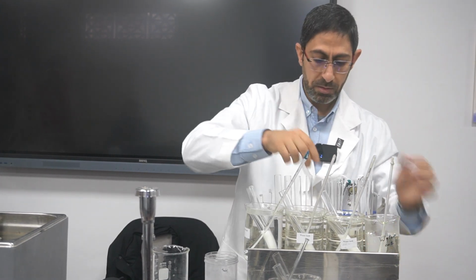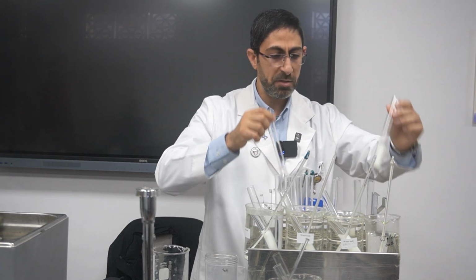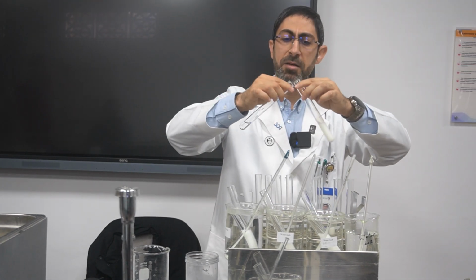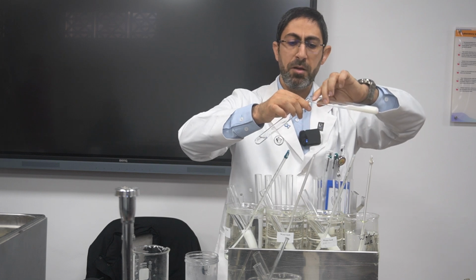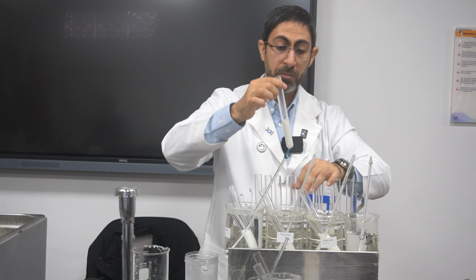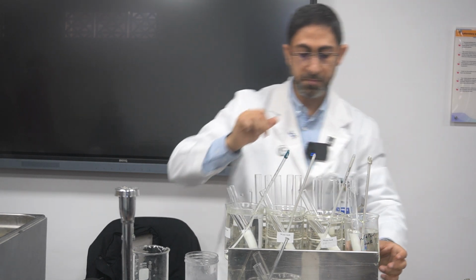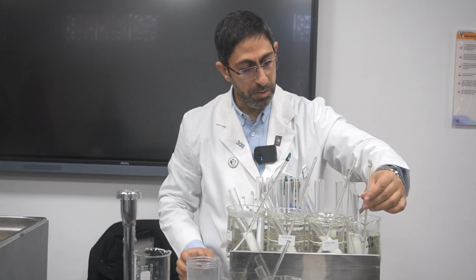Yes, please. Again, this is the 30 degrees Celsius. Okay, I will add the 10 centimeter cubed of the powdered milk with 2 centimeter cubed of the enzyme and 2 centimeter cubed of the buffer solution. Yes.